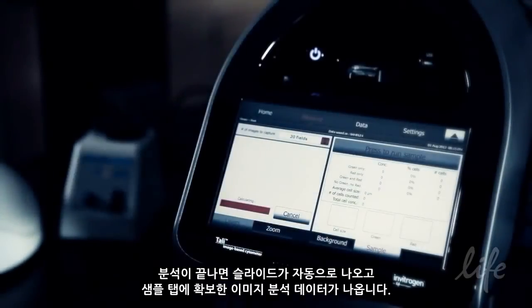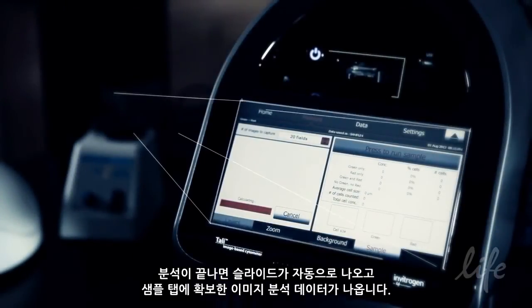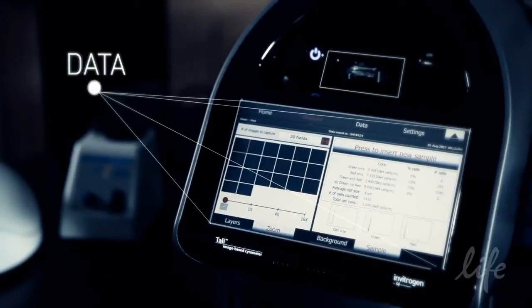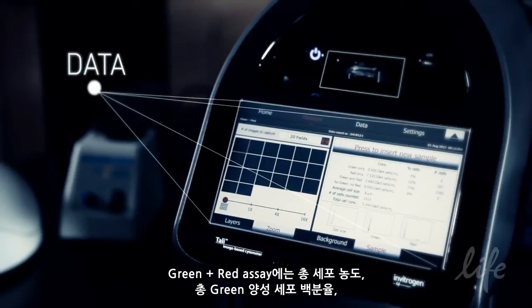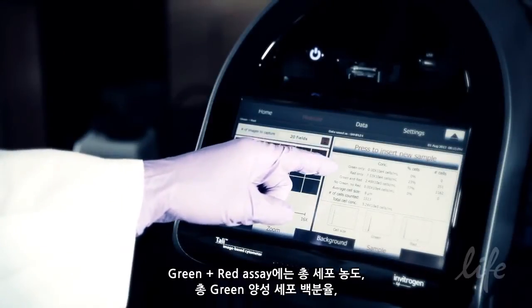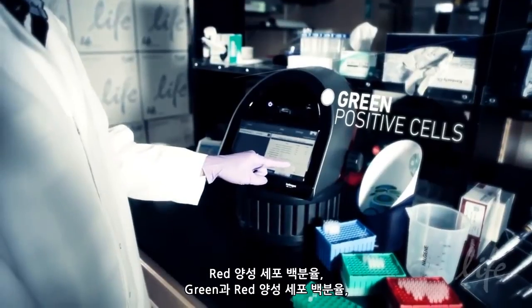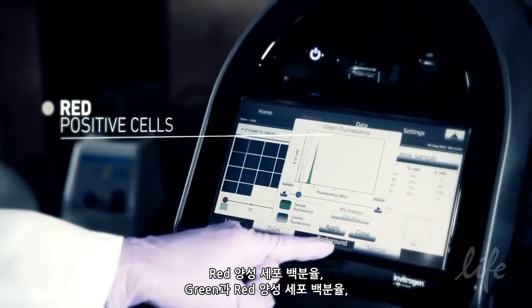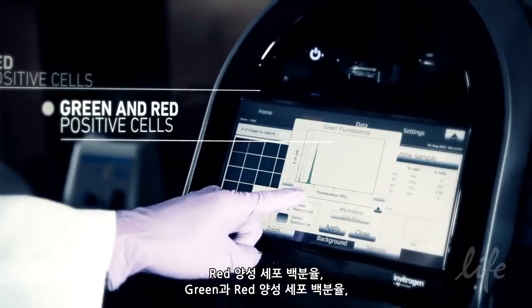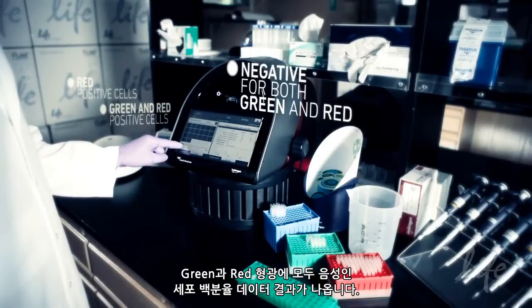After analysis is complete, the Tali automatically ejects the slide and provides the data from the analysis of the captured images in the sample tab. The Green Plus Red assay data includes the total cell concentration, percentage of total green positive cells, percentage of red positive cells, percentage of green and red cells, and percentage of cells negative for both green and red fluorescence.